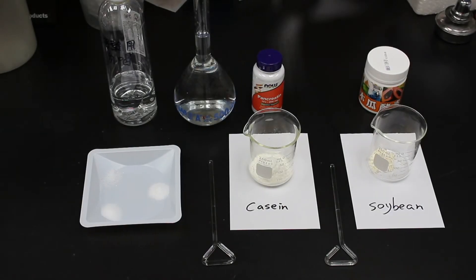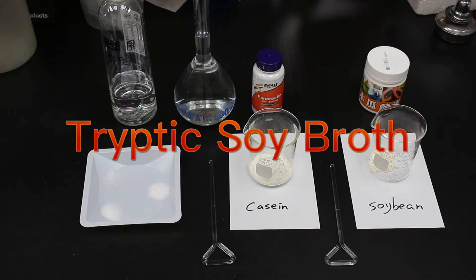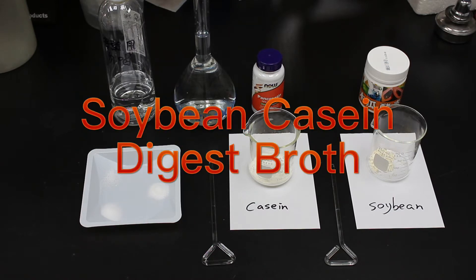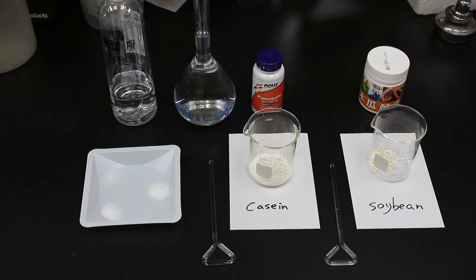Hello everyone, welcome to today's video. In today's video, I will try to make tryptic soy broth or soybean casein digest broth, which is a common growth medium for bacteria.